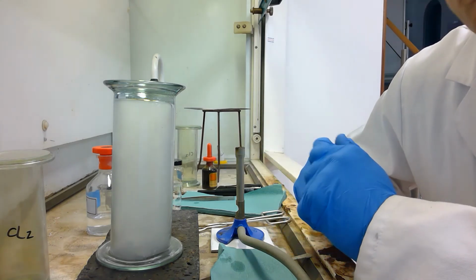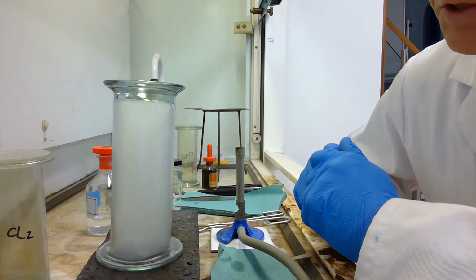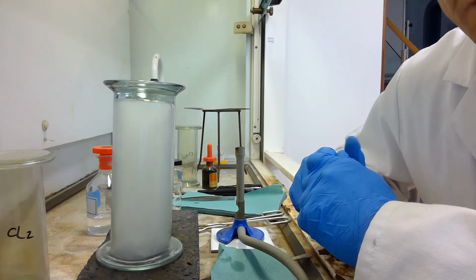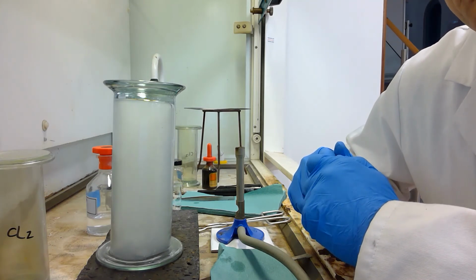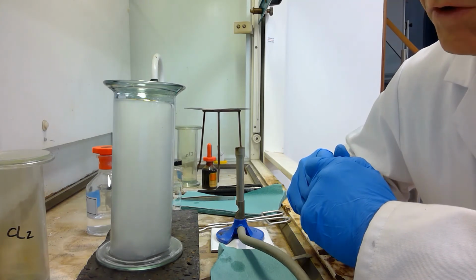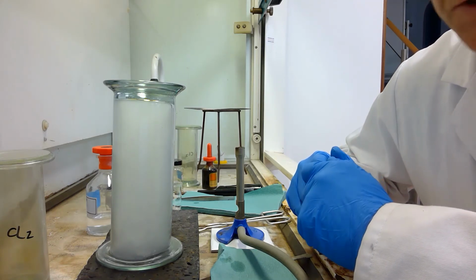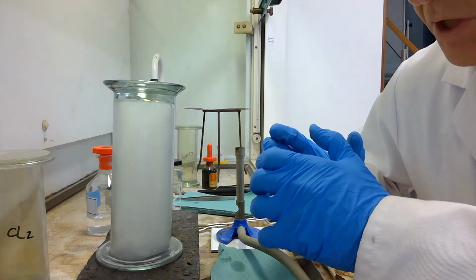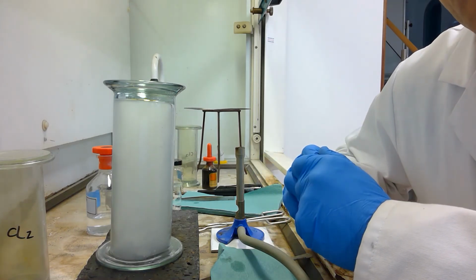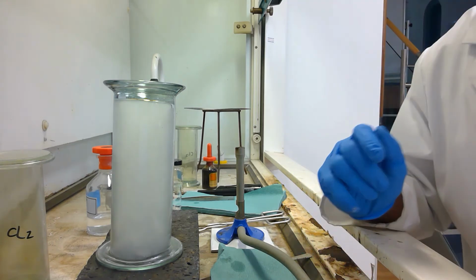If we leave this for several minutes, the white smoke will sink to the bottom and a white solid will be found at the bottom, and that white solid is of course sodium chloride. The sodium chloride will form a white disc at the base, and if there were no sodium and no chlorine left over after the end of the reaction, it will be perfectly safe to taste.